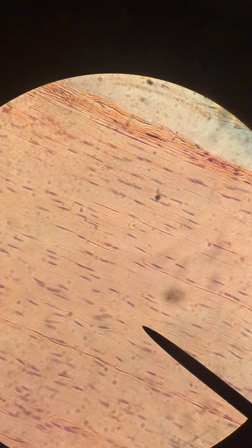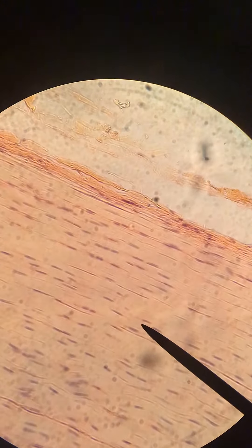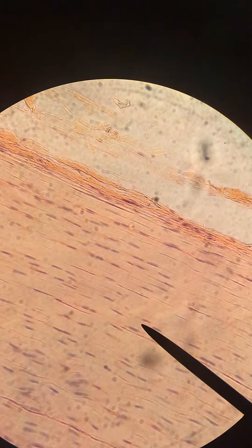Hi guys, this is slide 10. It's a tendon and so we are going to be looking at regular dense connective tissue. So this is in fact our regular dense connective tissue. I've already got us at 400 times magnification so we can see it as clearly as possible.